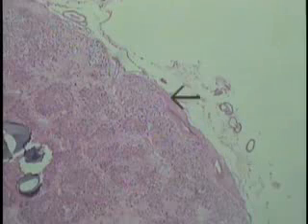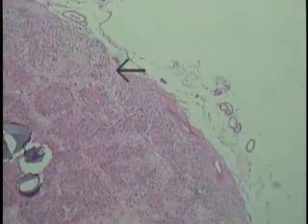This section is a relatively decent sample of a human pineal gland seen with the low power objective. The gland is surrounded by a thin connective tissue capsule that is intimately associated with adjacent pial tissue — the inner meninges — this vascularized structure. Here we can see a little bit of capsule coursing along the external surface of the gland, and the surrounding capsule sends connective tissue septa that subdivide the gland into smaller lobular units.